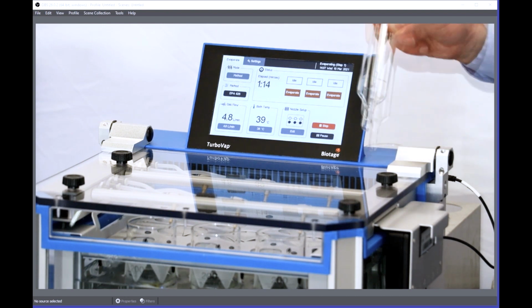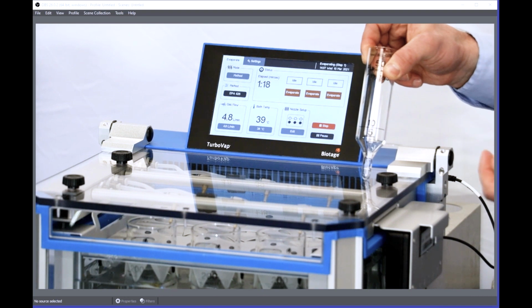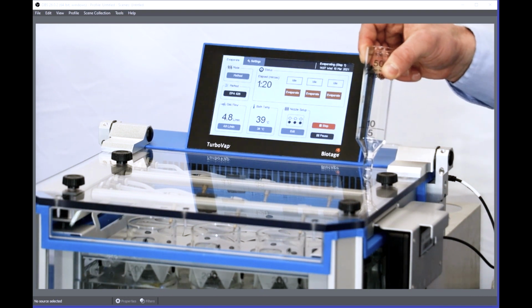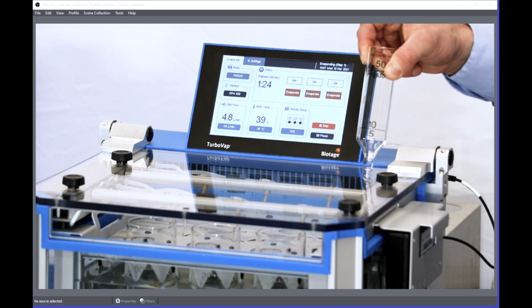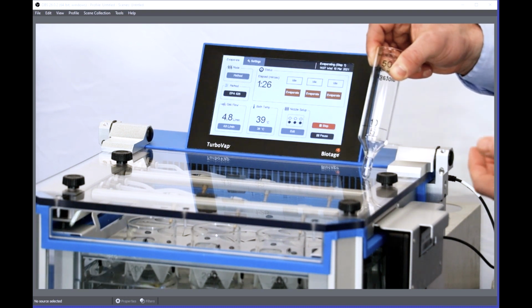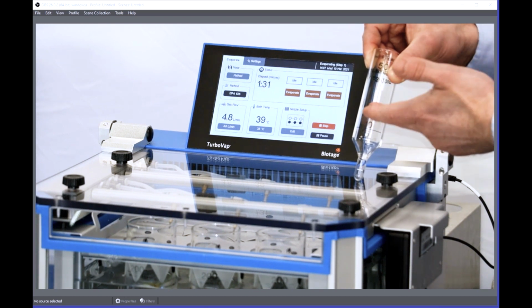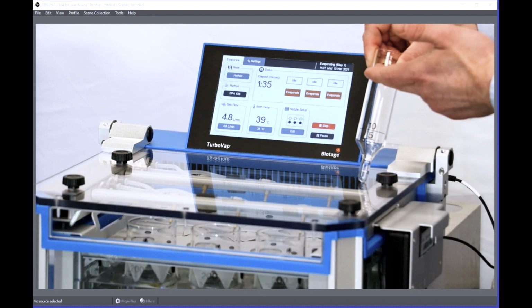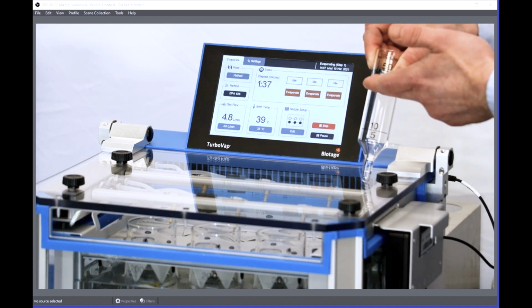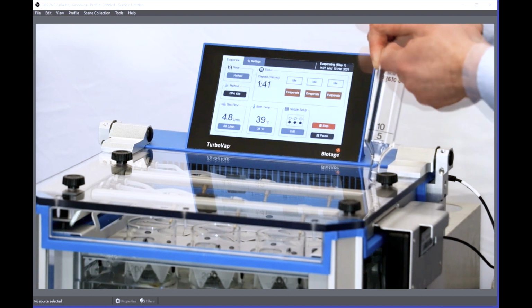Now, a lot of people will use this in a TurboVap 2 6 position if they want endpoint sensing. But what's unique about the new system is that now you have the ramping capabilities, you could actually optimize your concentration protocol to account for any variations in solvent volume, starting volume. So you will actually start to concentrate the tubes that are filled with more solvent first, because they'll start to vortex.